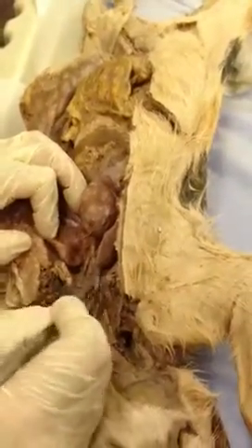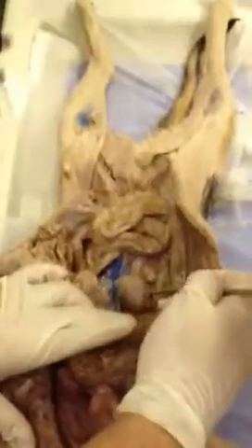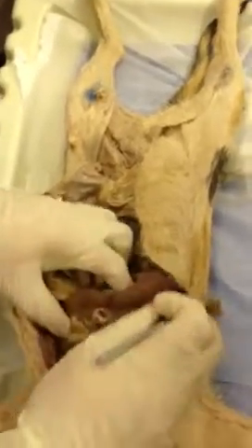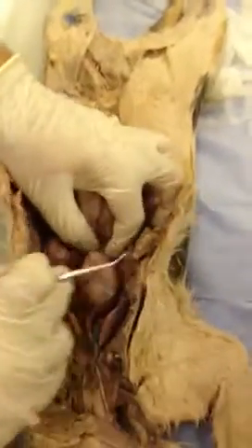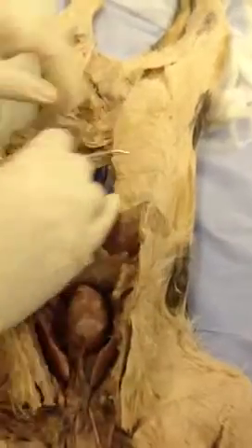All right, so what are we missing on this one? We can see how it looks down here. We got a nice supply of our renal circulation coming in here, and then let's see if we can, well, we can see the descending, in the inferior vena cava there.